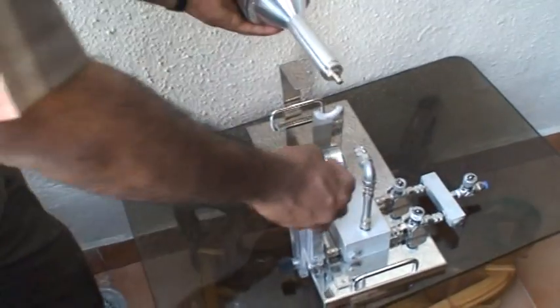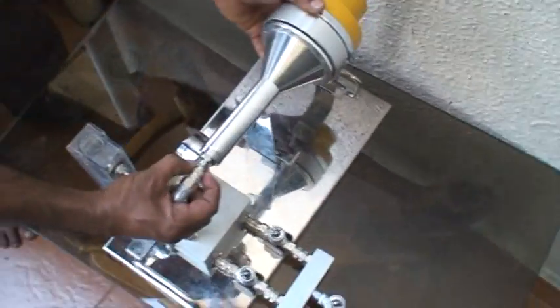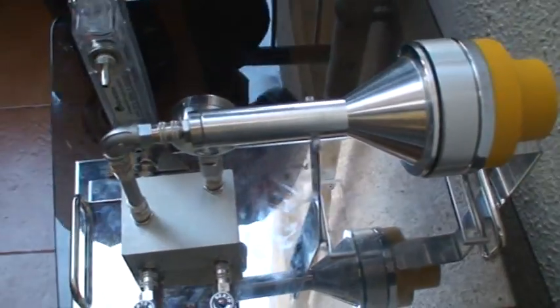It uses push-pull connectors, making it very easy — just pull it back, connect it, and release. It stands in place like this.